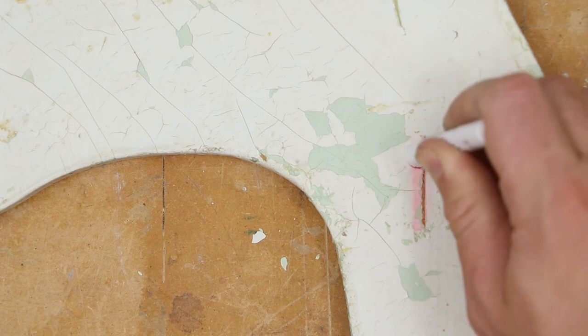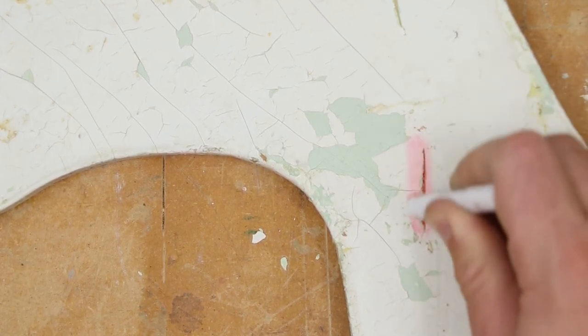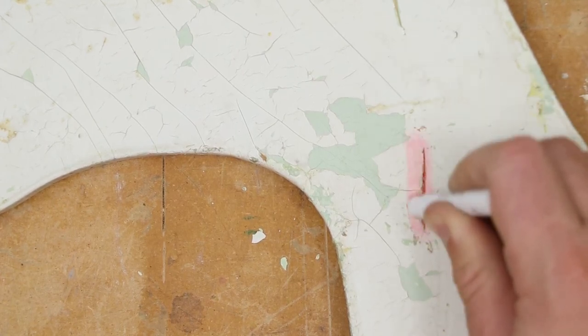And immediately, I get red and pink. So this has lead in this surface. I don't know which of the surfaces is lead.